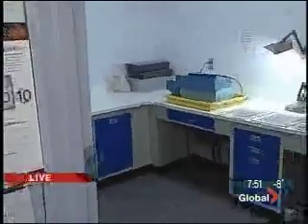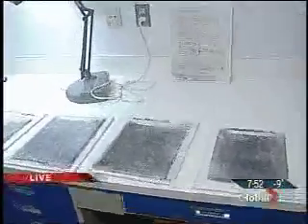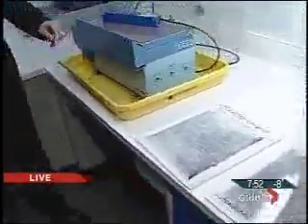Let's go into the other room. Absolutely. Set it up for us, if you would, Tim. Yes, what we're doing right now is we're going into another area where we're dealing with an examination that's done using handwriting, which is what we do in the section most of the time. But in this case, it's a little different. It's handwriting indentations, which you would find on, say, a blank sheet of paper.